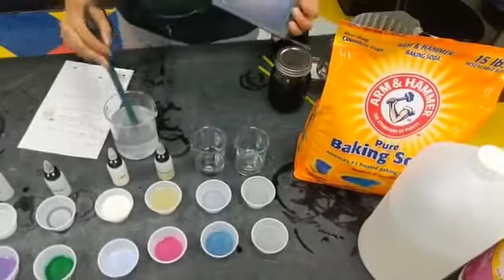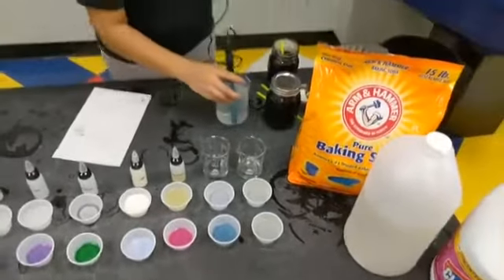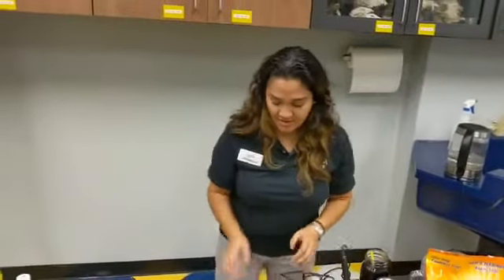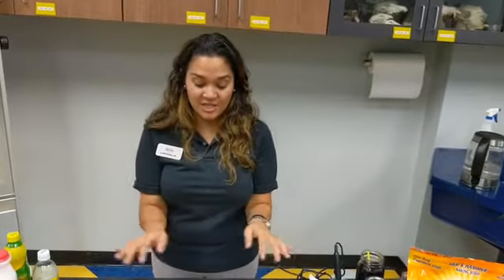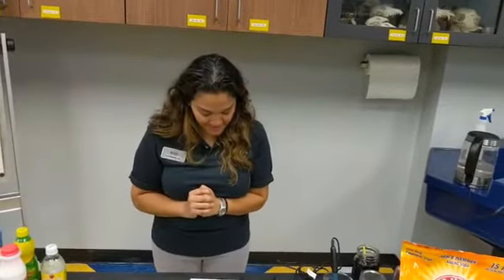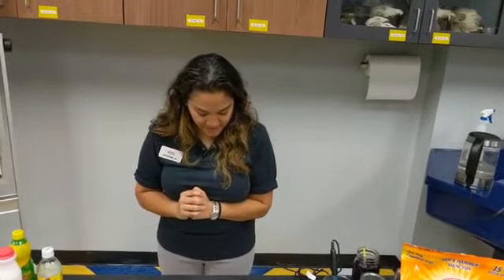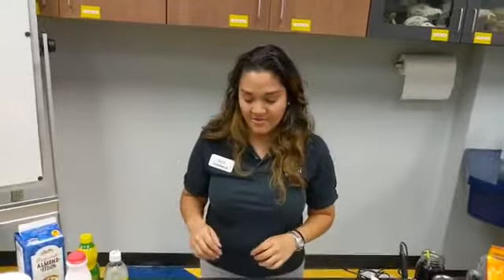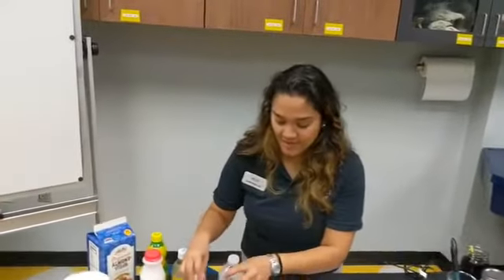All right, so that was our quantitative test, which means we get number results. And our cabbage juice indicator was a qualitative test, which means we get color results. Let's see. Right, we're gonna do our milk experiment. And then while I'm setting that up, I'm happy to answer any questions that might be there.